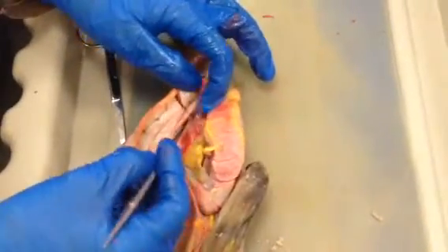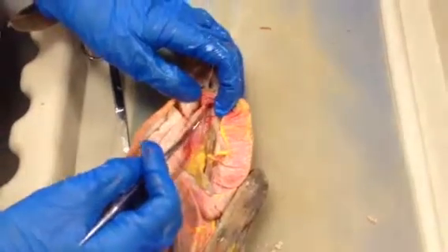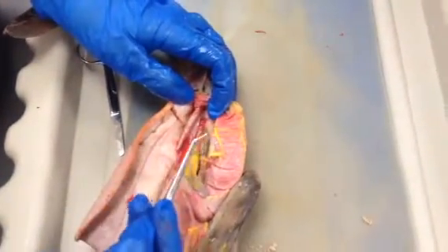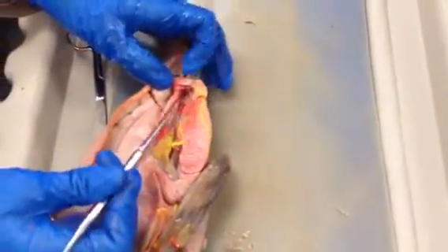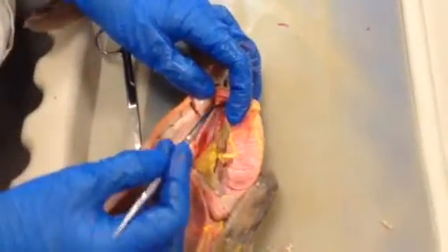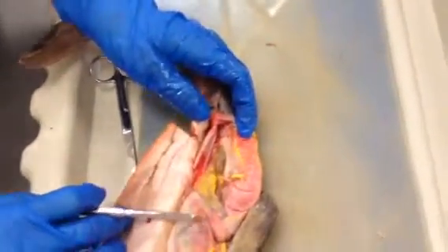And then the mesentery attaching it is called the mesocolon. Which is kind of weird because it's not attached to the colon. The thing most similar to the colon would be the valvular intestine, but the mesocolon here is attached to the rectal gland. Okay? We'll finish up with the gill stuff.